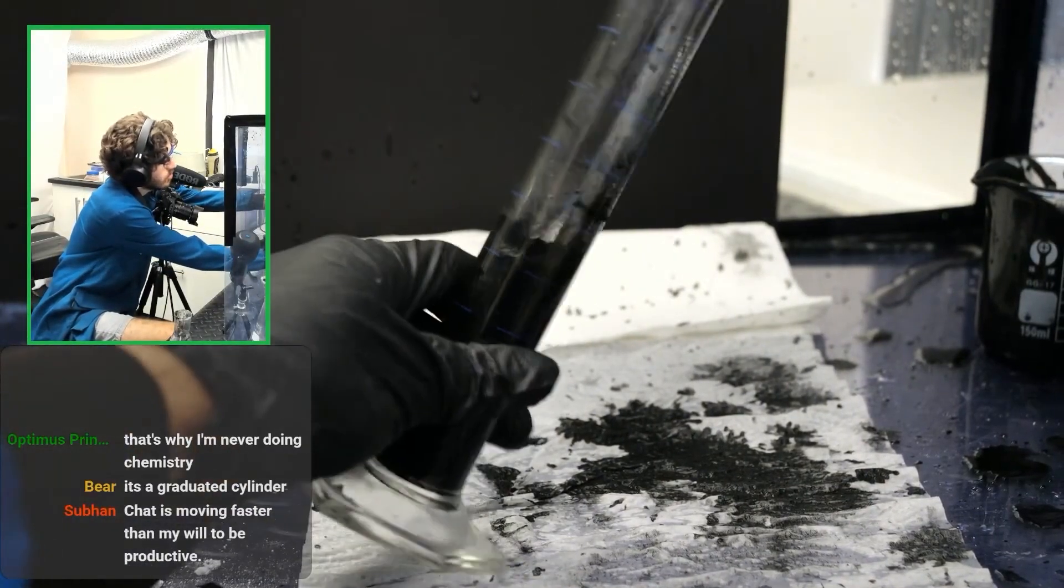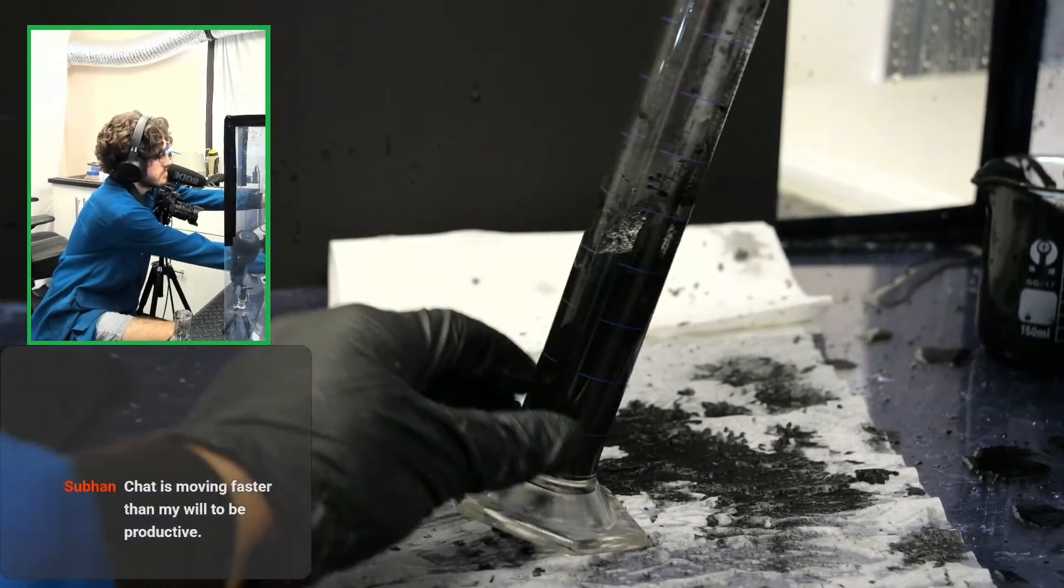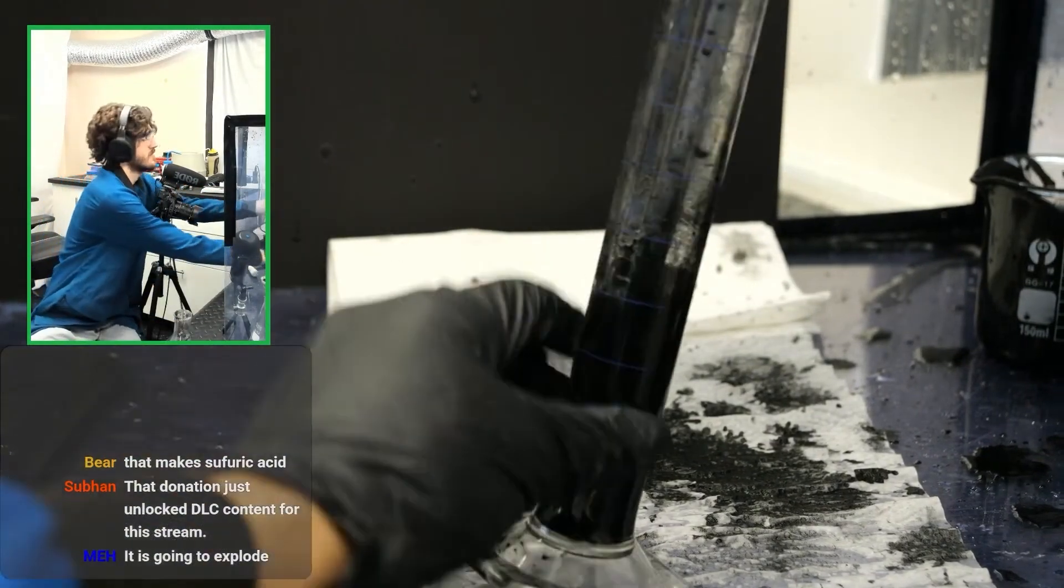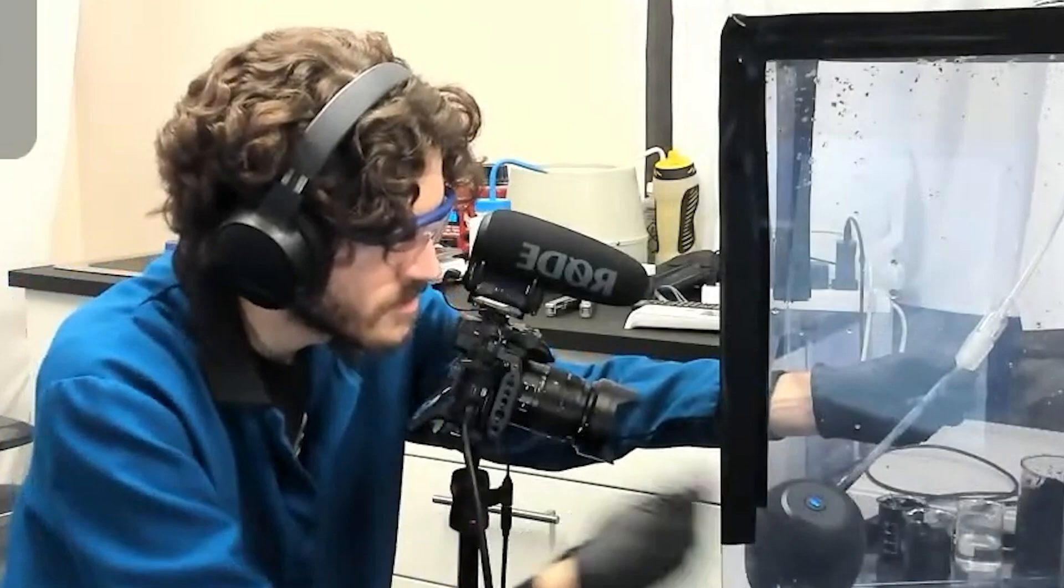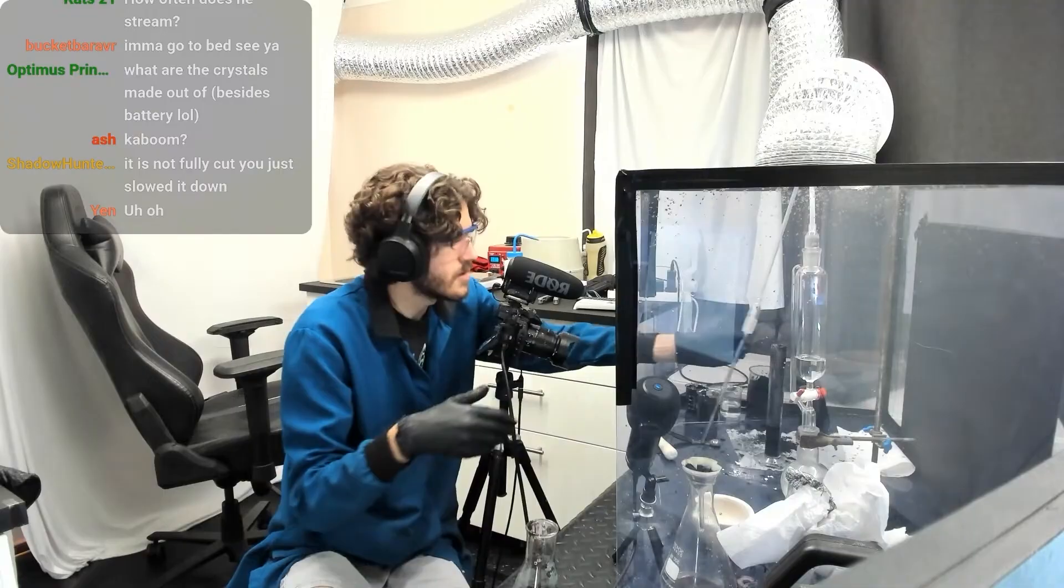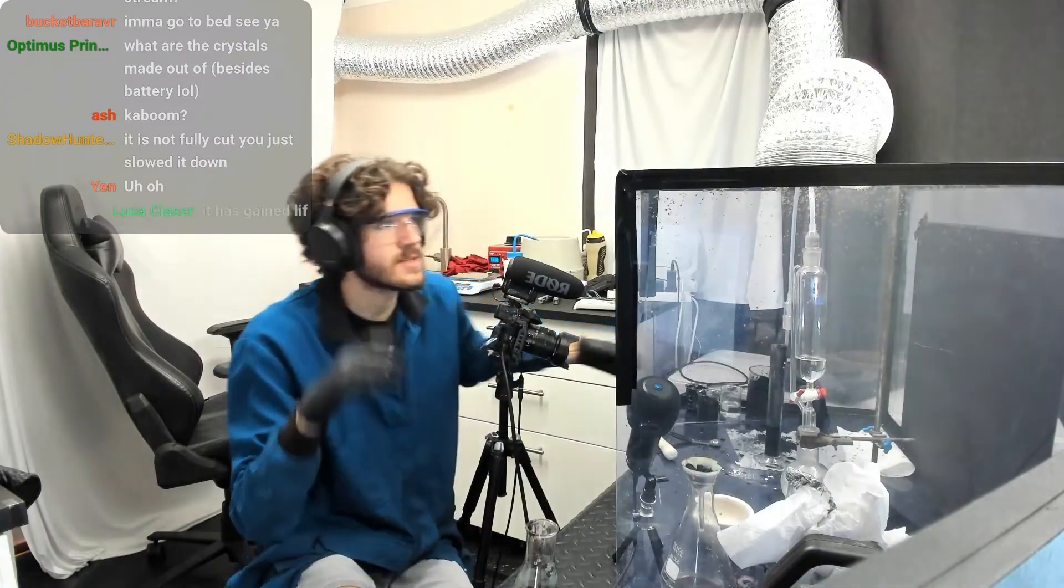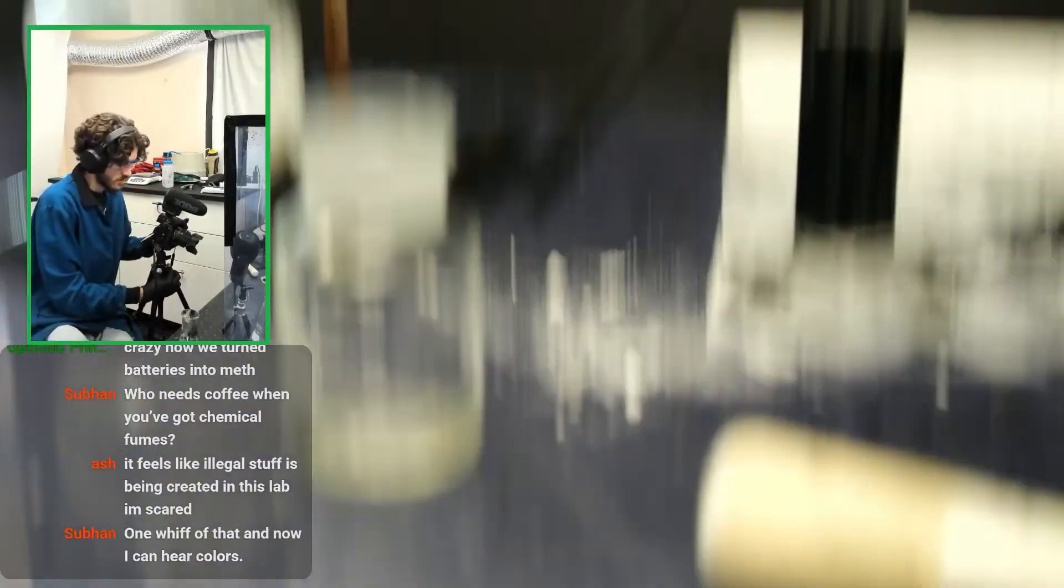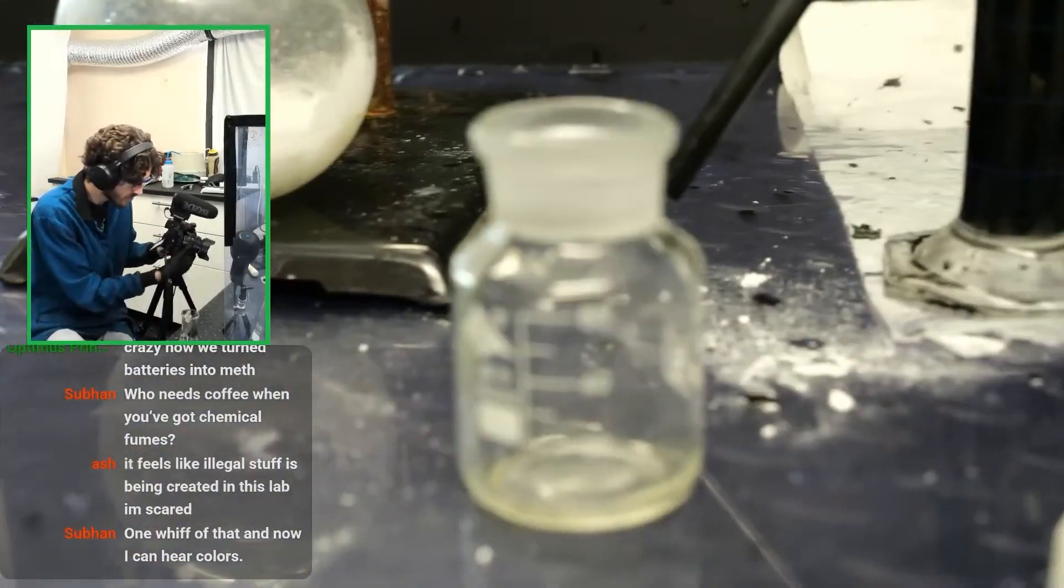Let me just give it a little mix. Oh shit. It's hot. I don't want to give it a sniff. I know, right? Terrible. Oh yeah. Yeah. No, that's sulfur dioxide. That's accurate. Yep. I think I just want to filter this and see what happens. How's that sound? It should be a pink solution. We should be getting close now.